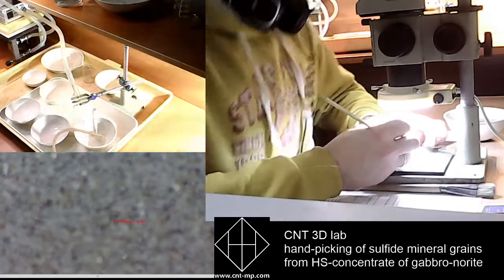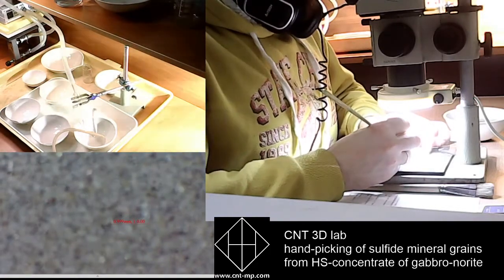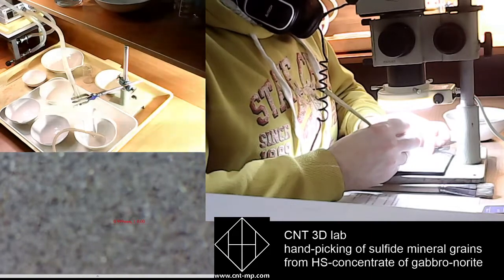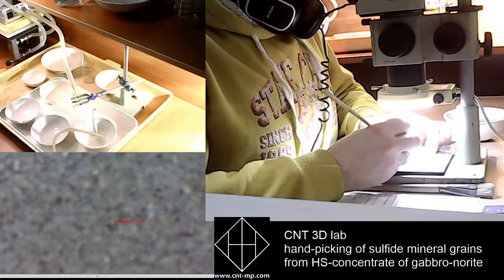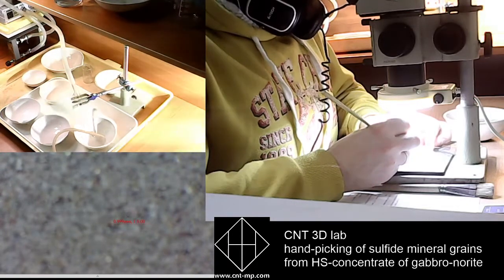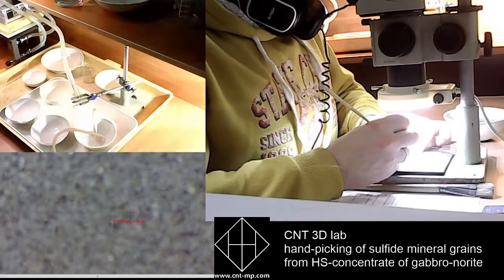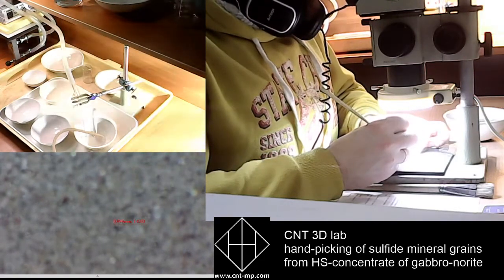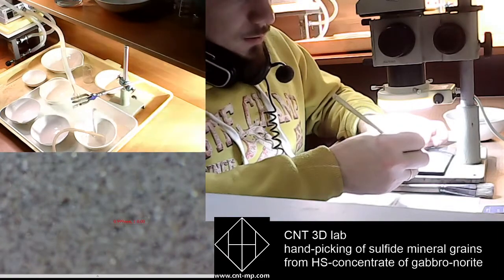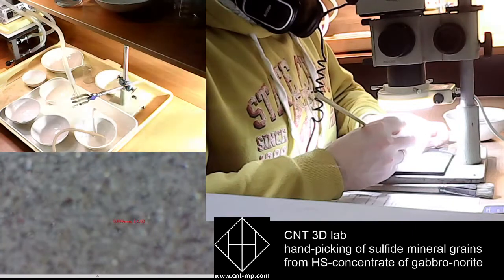I think it's still platinum because this is an ultramafic rock, gabbronorite, and this sample was detected near the contact zone of a mineralized vein.